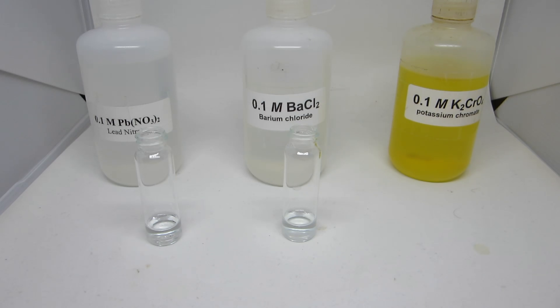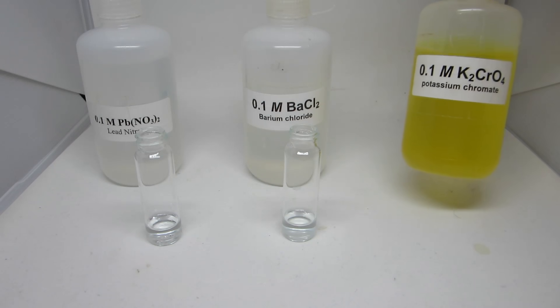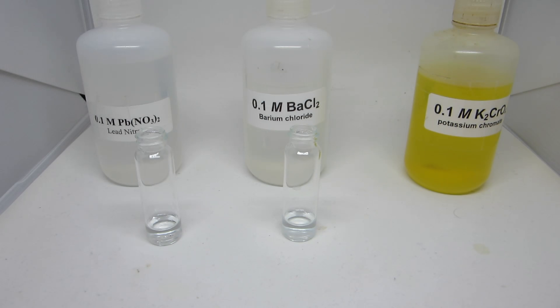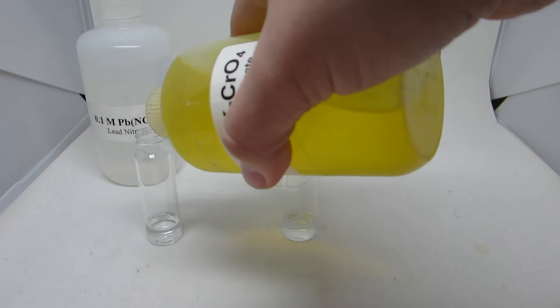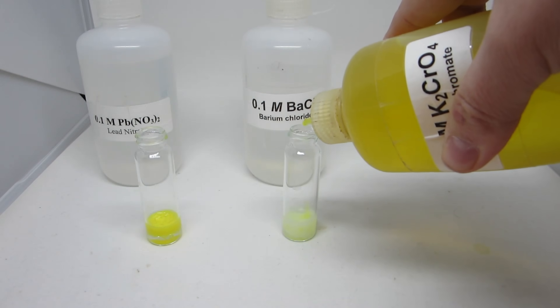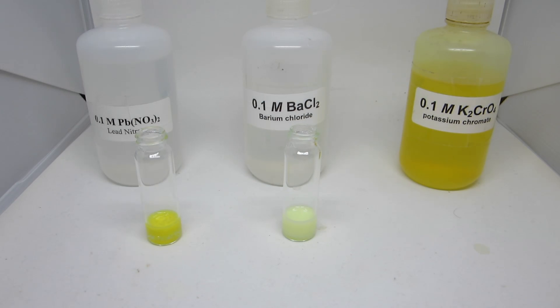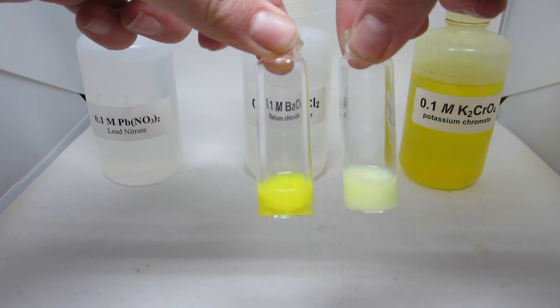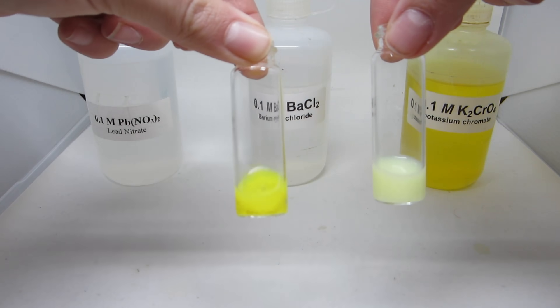In the eighth and ninth reactions, you're mixing lead nitrate and barium chloride with potassium chromate. Both lead nitrate and barium chloride solutions are clear and colorless. Upon addition of potassium chromate, both solutions form a yellow precipitate. However, there is a stark contrast between the intensity of these yellow precipitates — the barium chromate precipitate is a much duller yellow color, while the lead chromate precipitate is intensely colored.